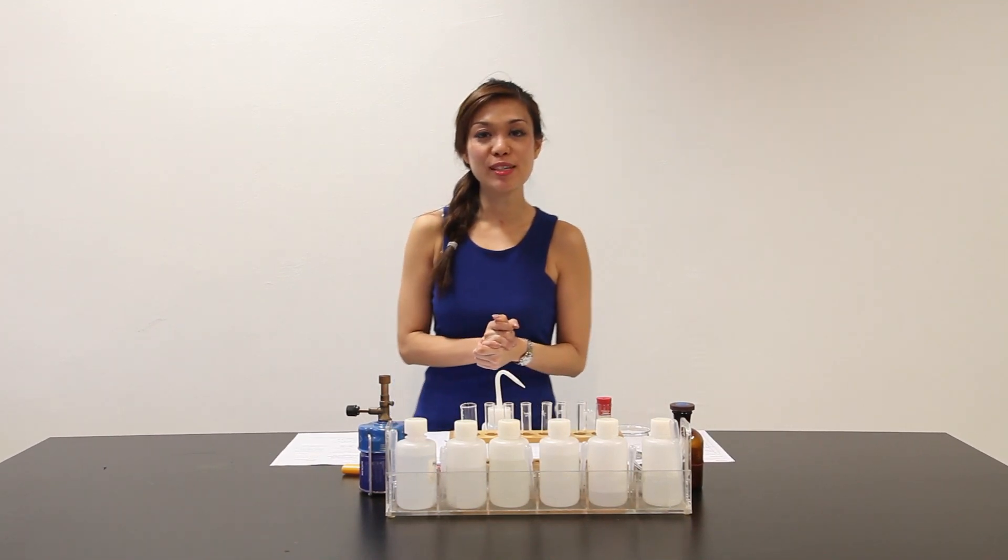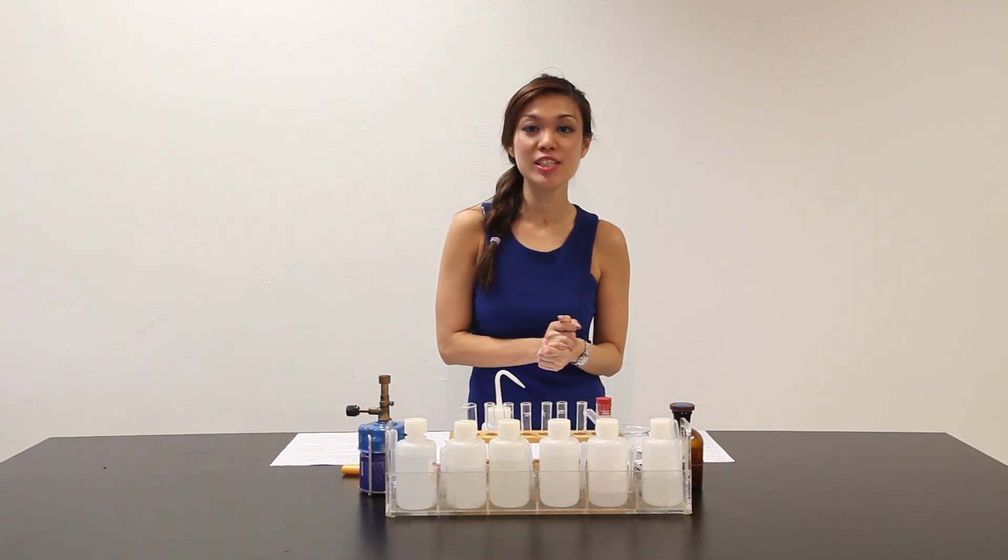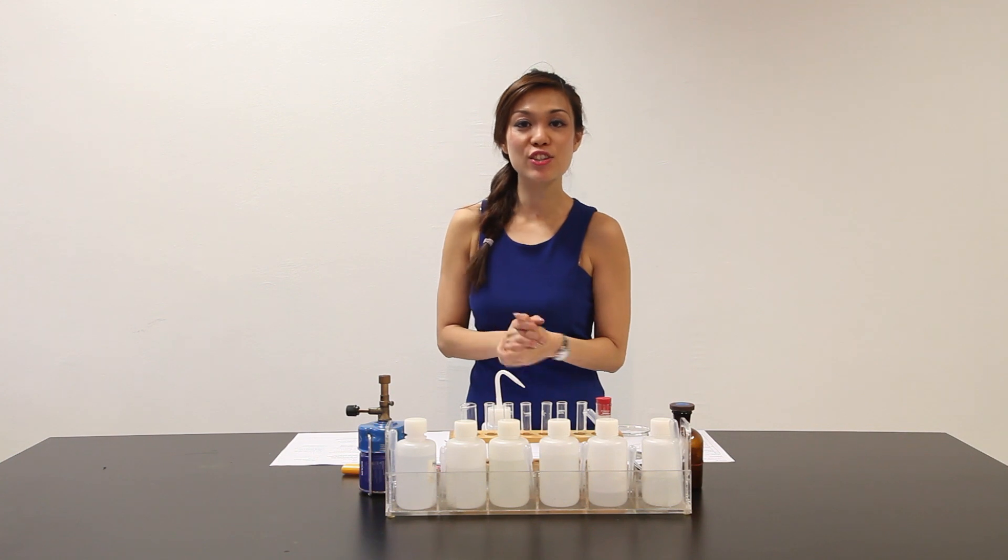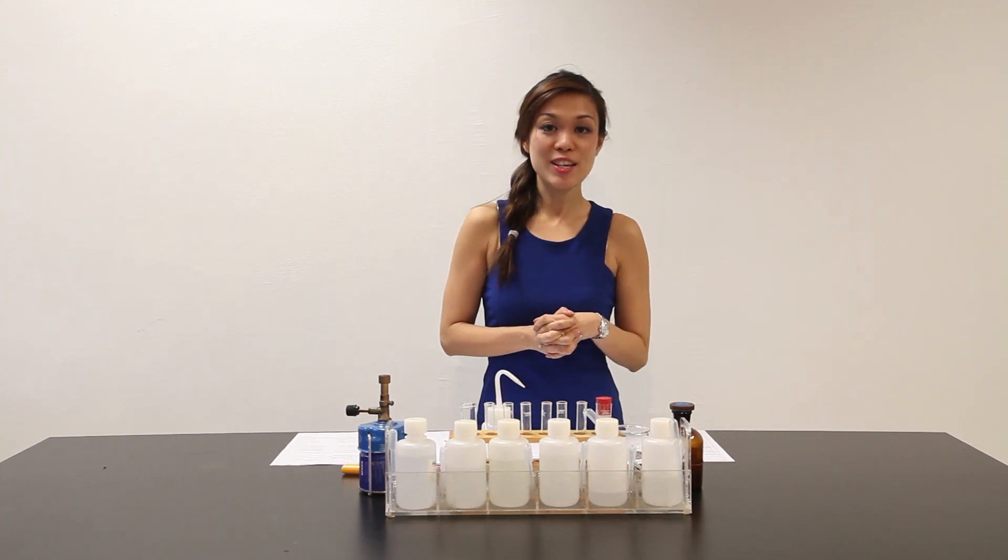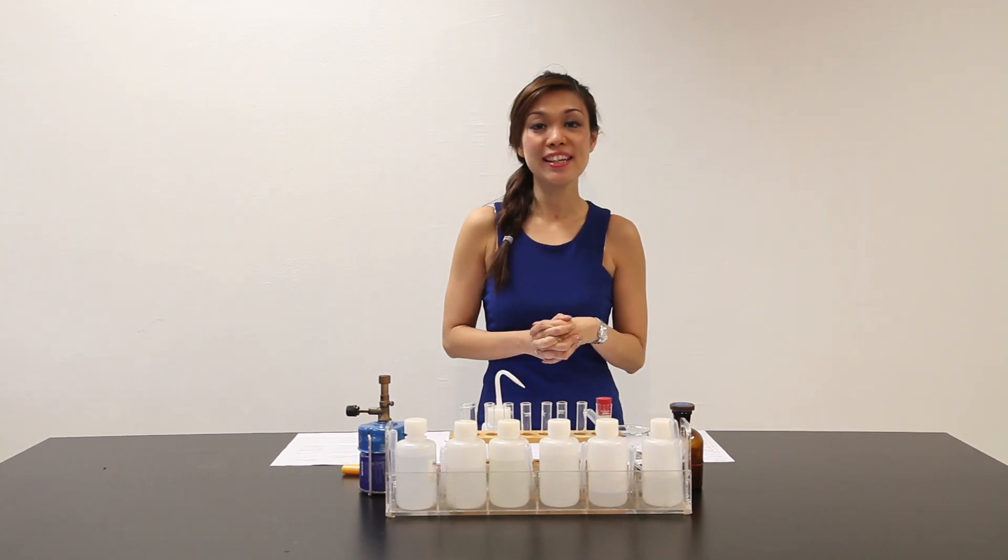Hi, welcome to another episode of practical with Ms. Selina. Today we're going to do 2010 GCE O-level practical. So let's begin the preparation and the execution.